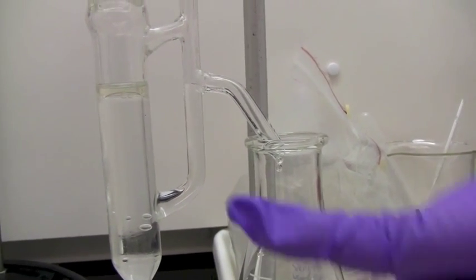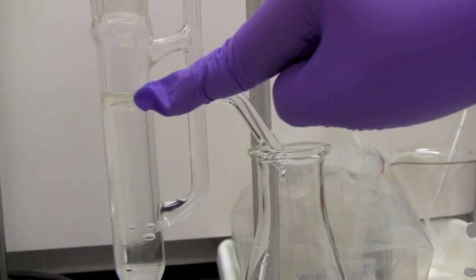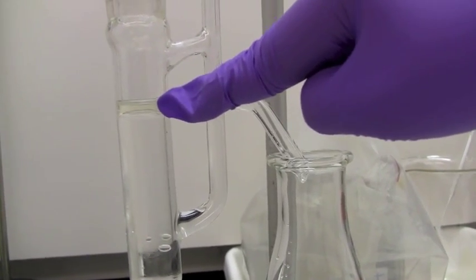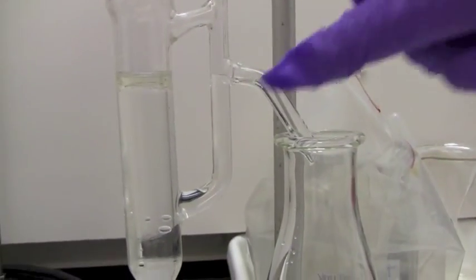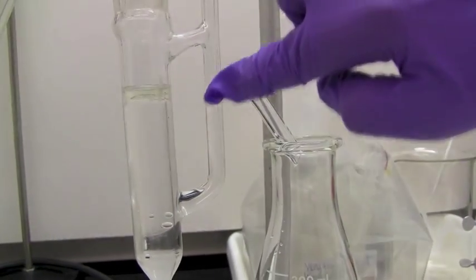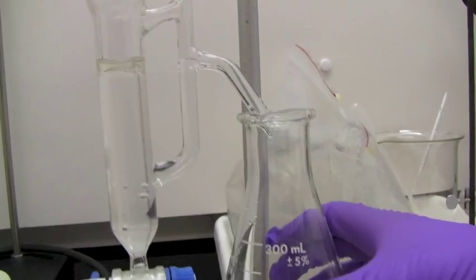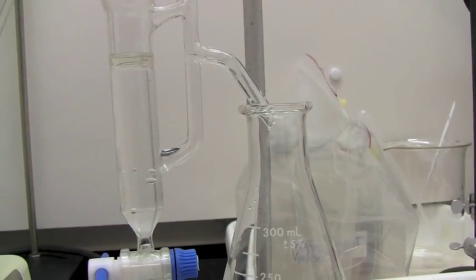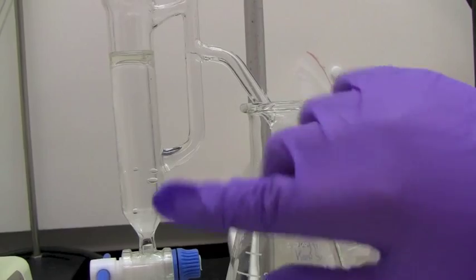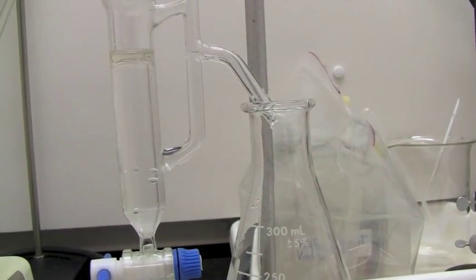So as you can see, there's a slight layer that's the oil on top and the rest is just the water. So the water is being pushed up, or the liquid is being pushed up through this tube and into the Erlenmeyer flask. Some drops have already come out. So the liquid is being pushed out and the oil just stays on top.